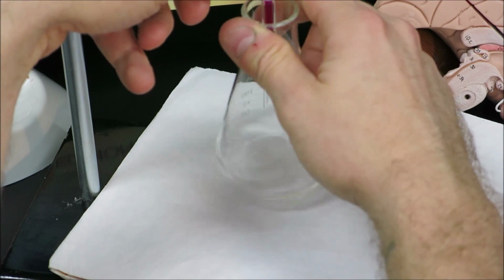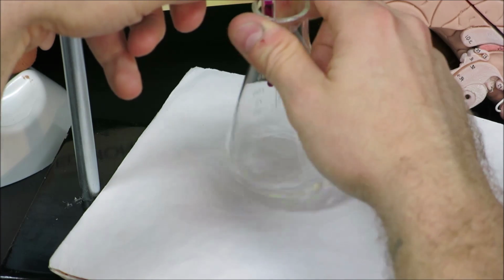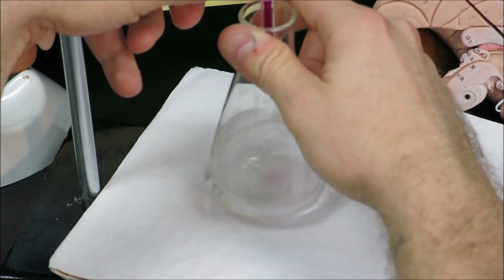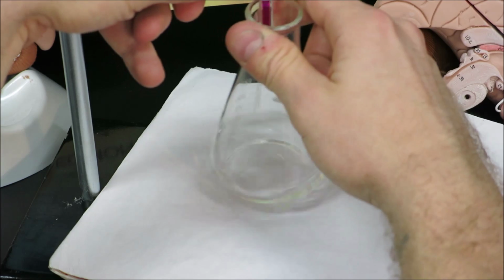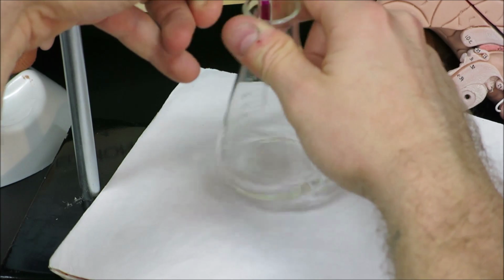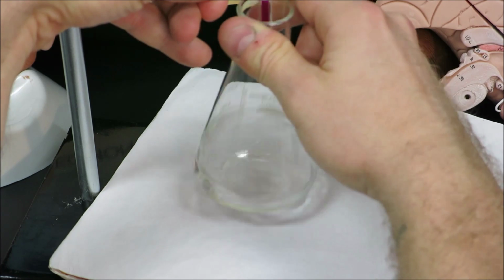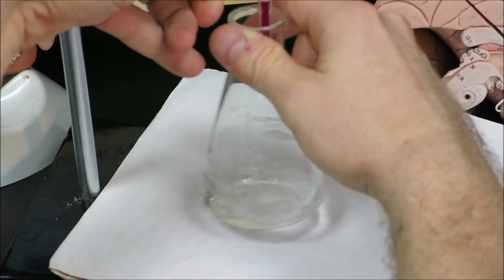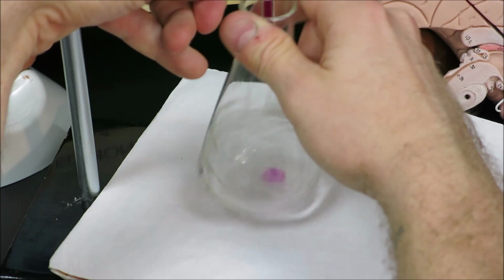It is important to have two data tables ready to record results. The first data table was the standardization of the permanganate using acidified iron 2 ammonium sulfate. The second data table we should have here is now the titration of acidified peroxide, and we could even say acidified diluted peroxide, as the hydrogen peroxide was diluted 40 times before beginning the titration.